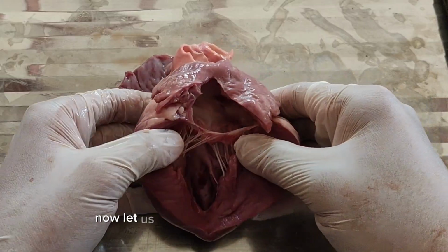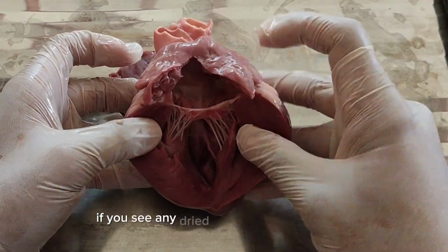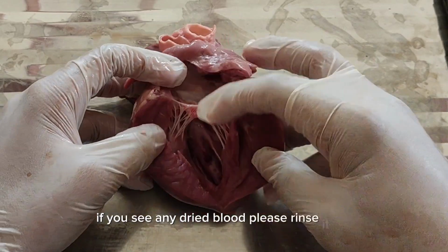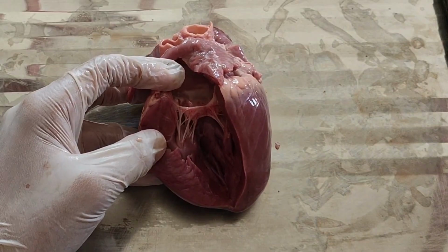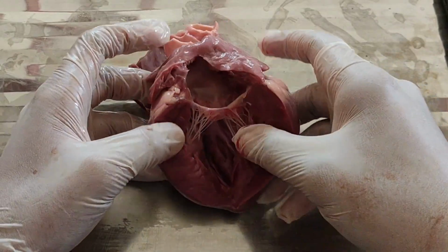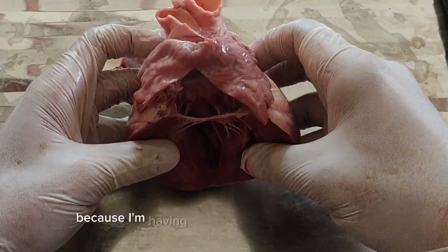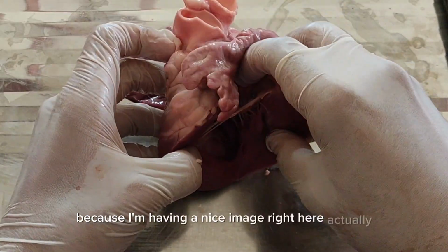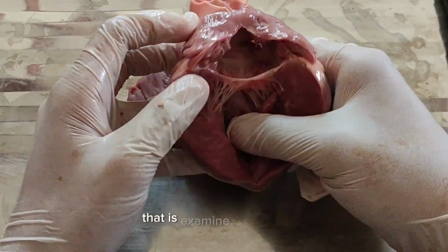Now let us open the heart at its cut with the fingers. If you see any dried blood, please rinse it out. Okay, I'm not cutting through it yet because I'm having a nice image right here. Let us examine the left atrium.